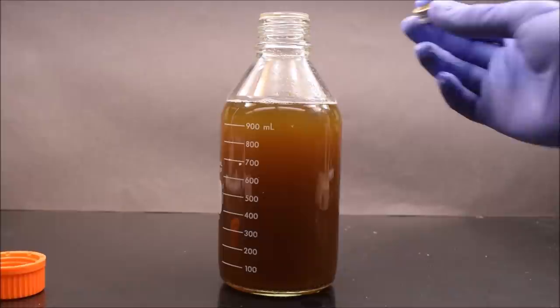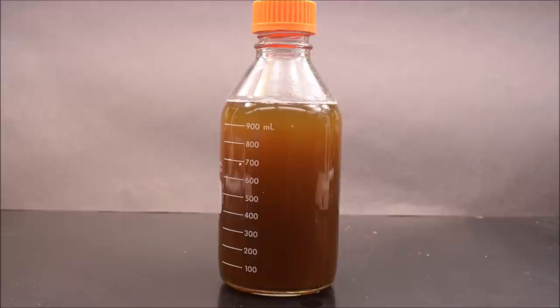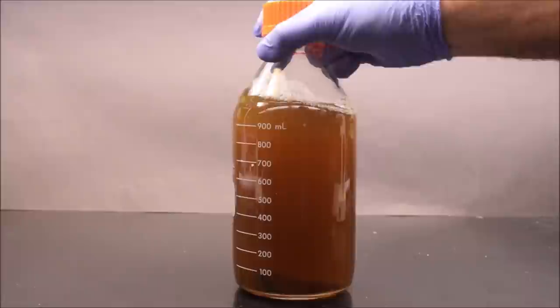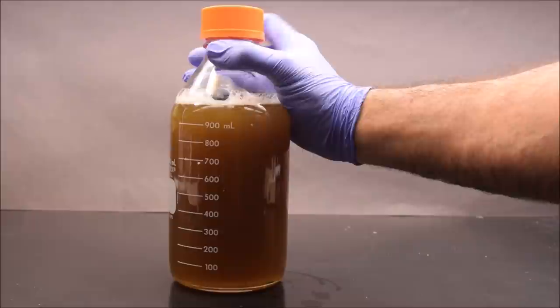I added two tablets to one liter of the dirty water. The instructions state to cap loosely to allow for a small amount of leakage, wait 5 minutes, shake the container to allow screw threads on the closure to be moistened, then tighten the cap, and wait 30 minutes before drinking. If you use the neutralizing tablets to improve taste, wait 30 minutes before adding them to allow the water to be disinfected. It's been 30 minutes — let's take a look and see how well the tablets worked.